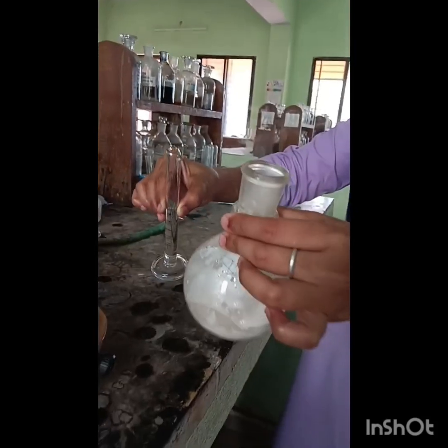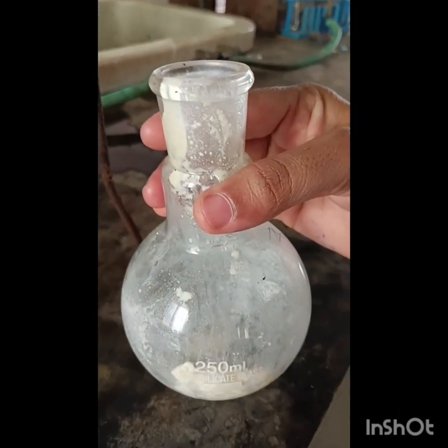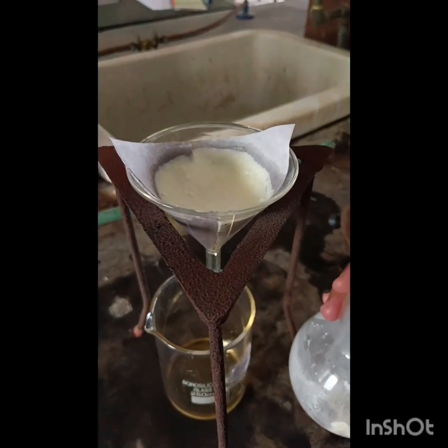Now we can see the precipitate (PPT) formation. After formation of the precipitate, filter it through the filter paper.